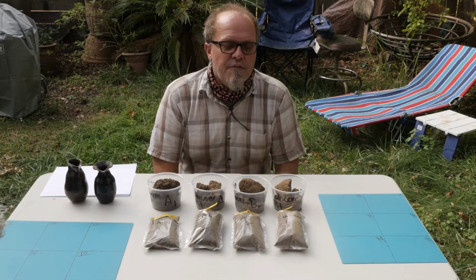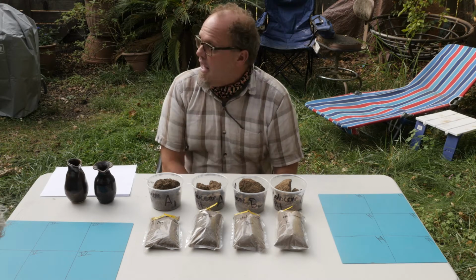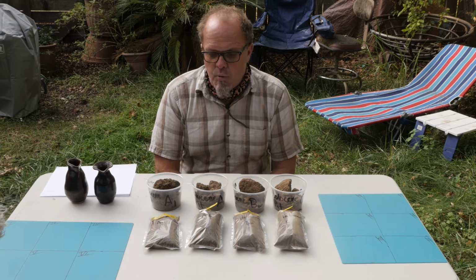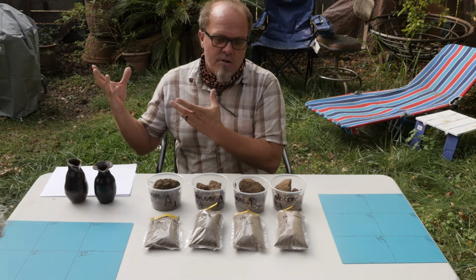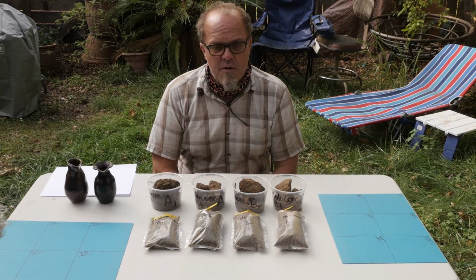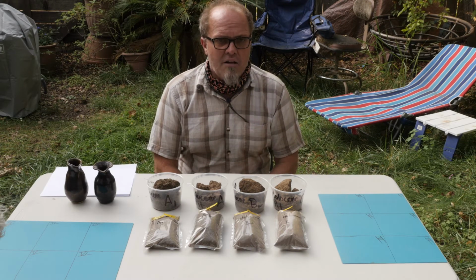Here we are. We left the farm after our last segment of sampling and processing, and now we've posted up in Irf's front yard in beautiful downtown Chico. What we want to do now is move on from field and sampled soils. We already sieved them down to the less than 2 millimeter fraction, which is sand, silt, and clay-sized particles. And now we're going to show you about hand texturing and set up some other analysis moving into the coming weeks.